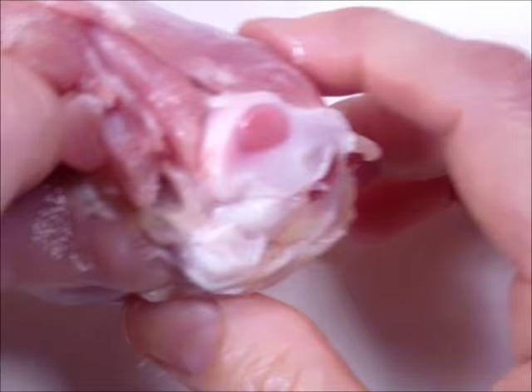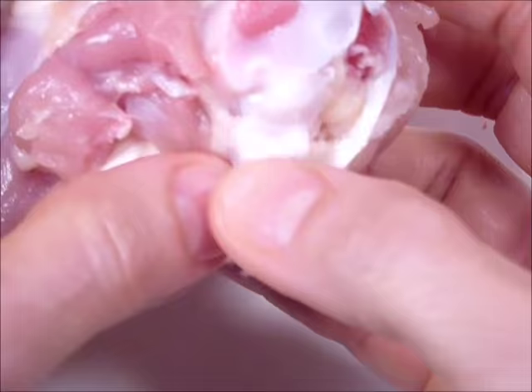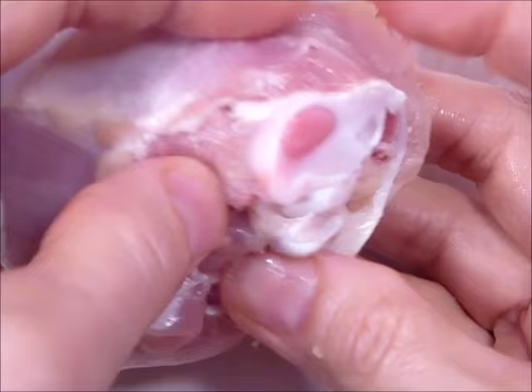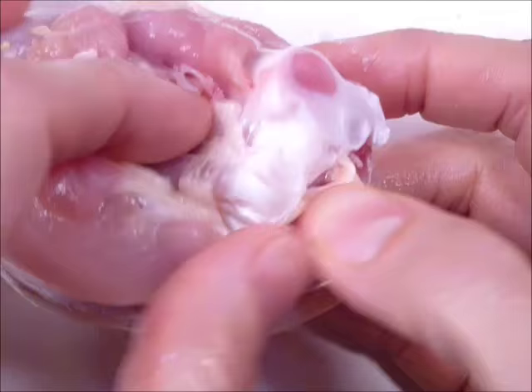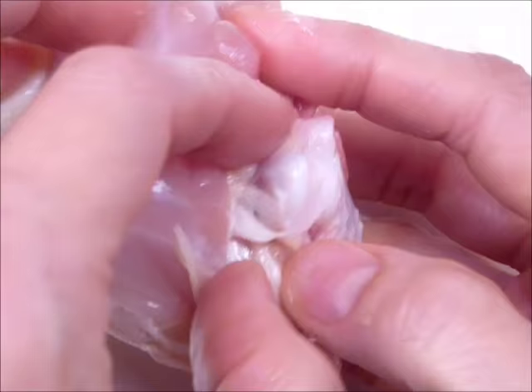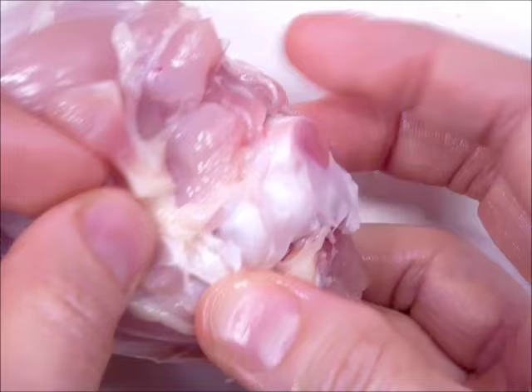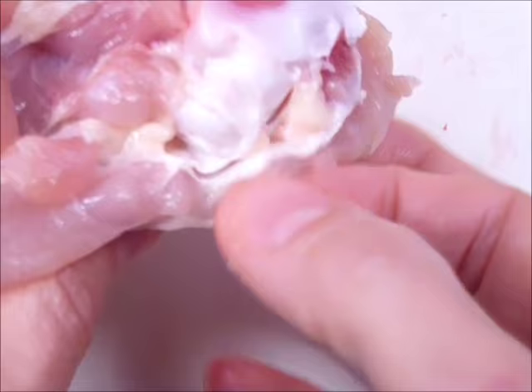Looking at this end that's been cut for us, we can see some red marrow in the bone. There's a little more hyaline cartilage. Do you see any ligaments? Ligaments connect bone to bone. They really chopped right through this joint — we'd have to get one with the thigh attached to see the ligaments. There's more hyaline cartilage here, a lot thicker, making a nice solid thick piece going around as a covering.